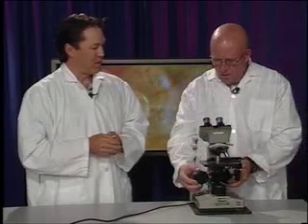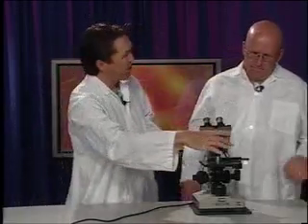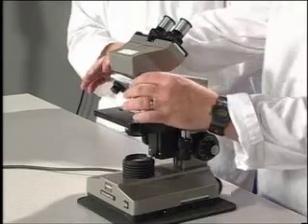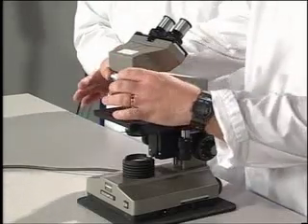So what should I do? Like, I know I don't want to hit that lens with this thing. Should I use this thing to go down, or what should I do first? There's a sort of a procedure that we use to ensure that we don't break anything. The first thing that you'll want to do is turn the revolving nose piece right to low power. Gotcha. And that'll immediately get some distance between the specimen and the objective lenses.